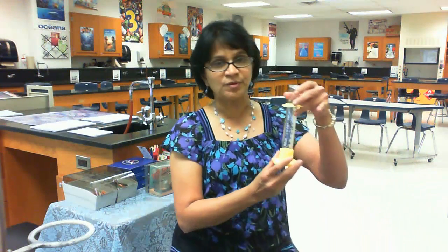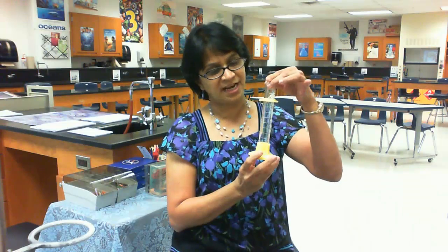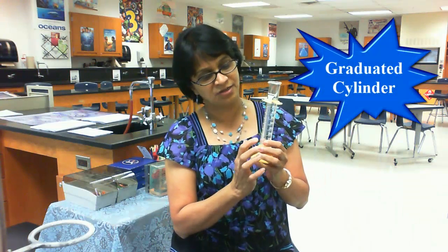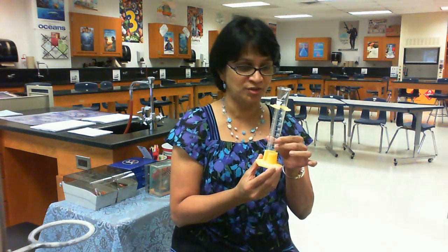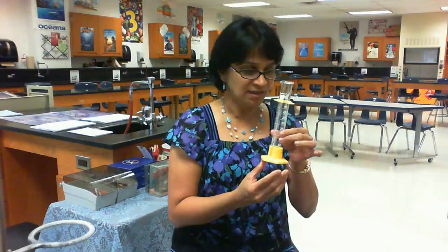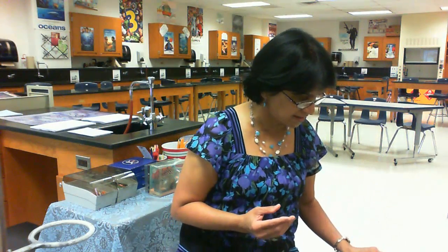The third equipment is the graduated cylinder. It has fine markings and we can get a precise measurement of how much liquid we are going to add for a reaction.